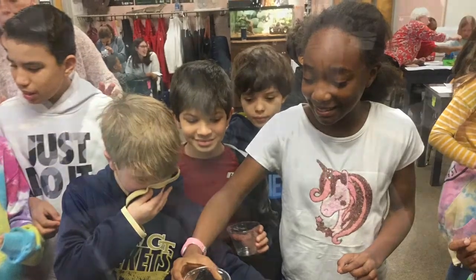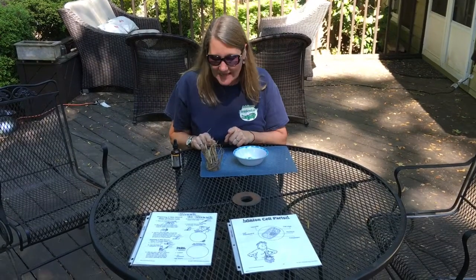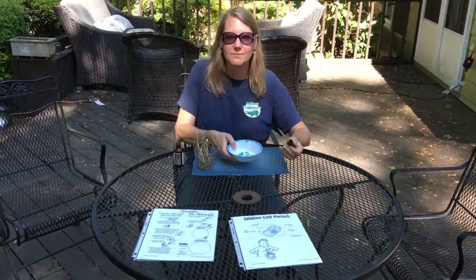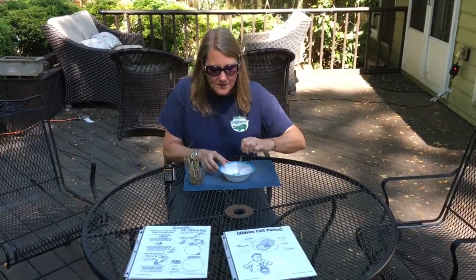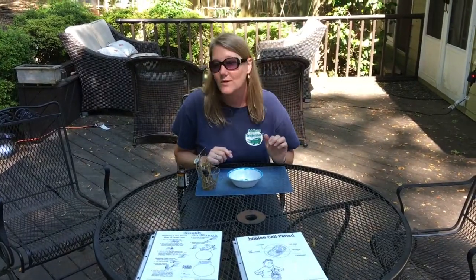Part two of looking at cells in the science lab, we got to experience what it was like to look at a drop of pond water under the microscope. I collected pond water three weeks before we looked at it, got some hay from the Tingle family, fed it with nutrients from the hay, let it fester — and it did smell! What we did was take a drop of the pond water and put it into what's called a depression slide, which is shaped like a bowl, so the critters could still swim around under the microscope. We saw things called protists — they can be one cell or multi-cell, but they are microscopic.